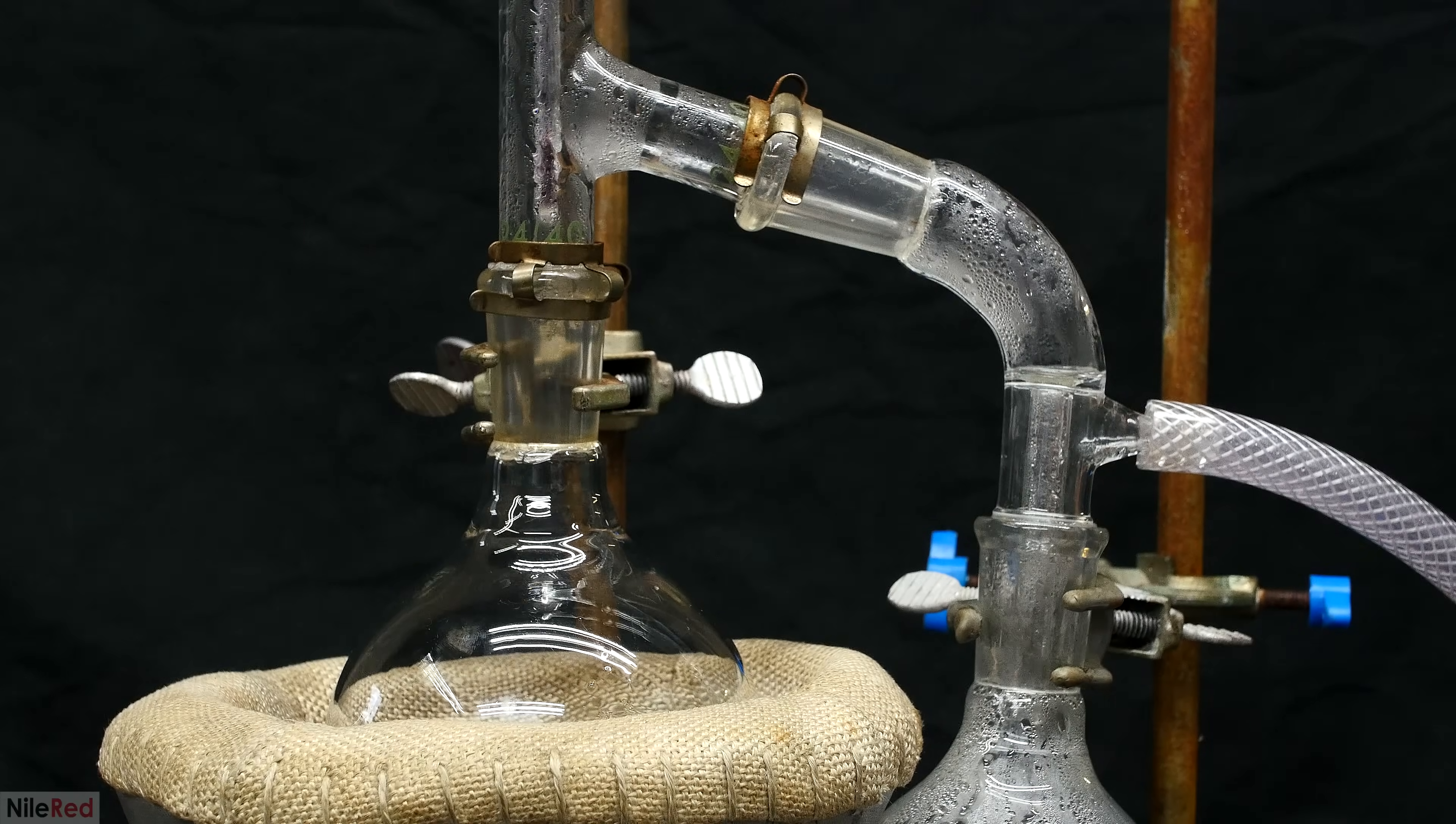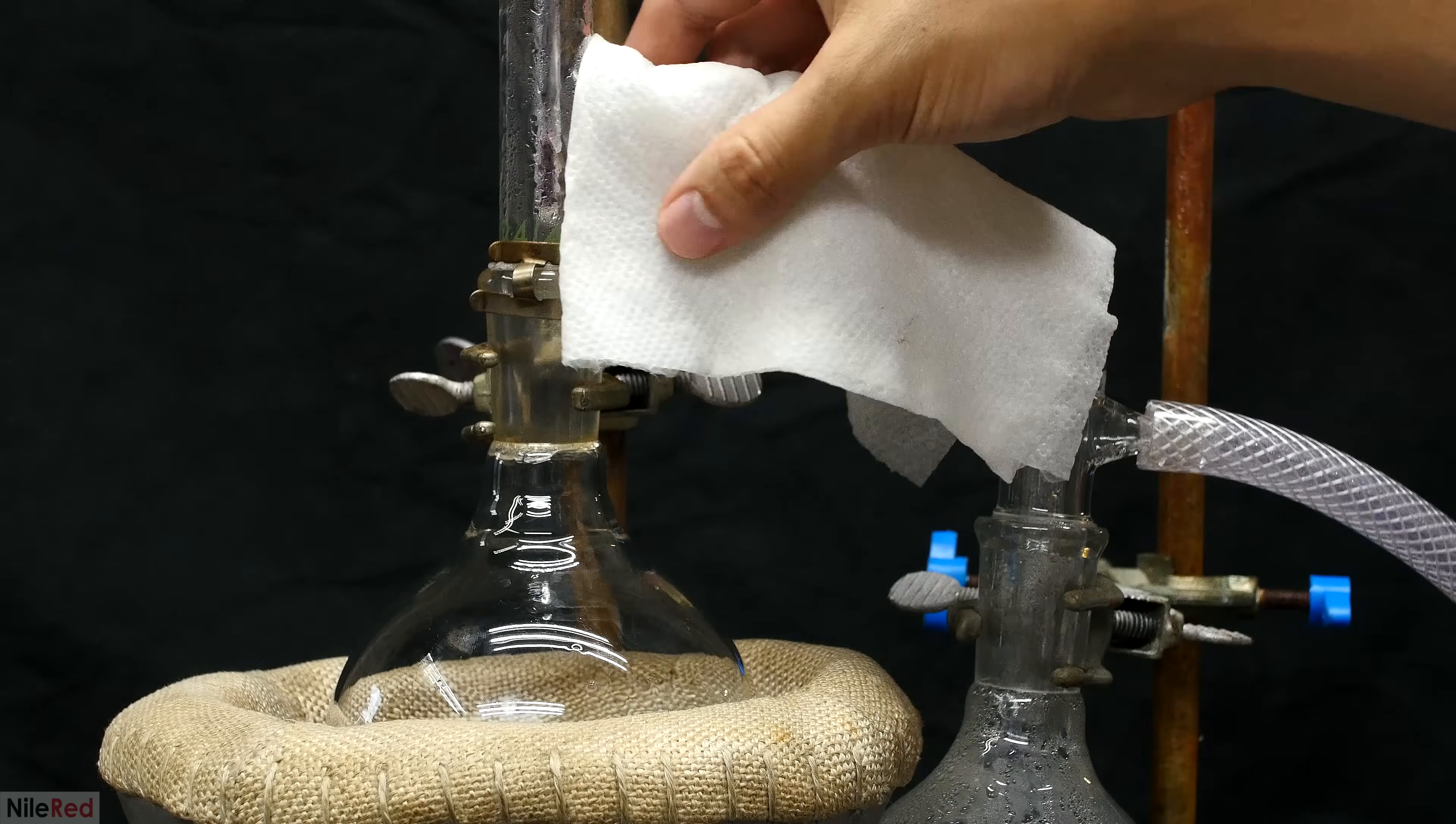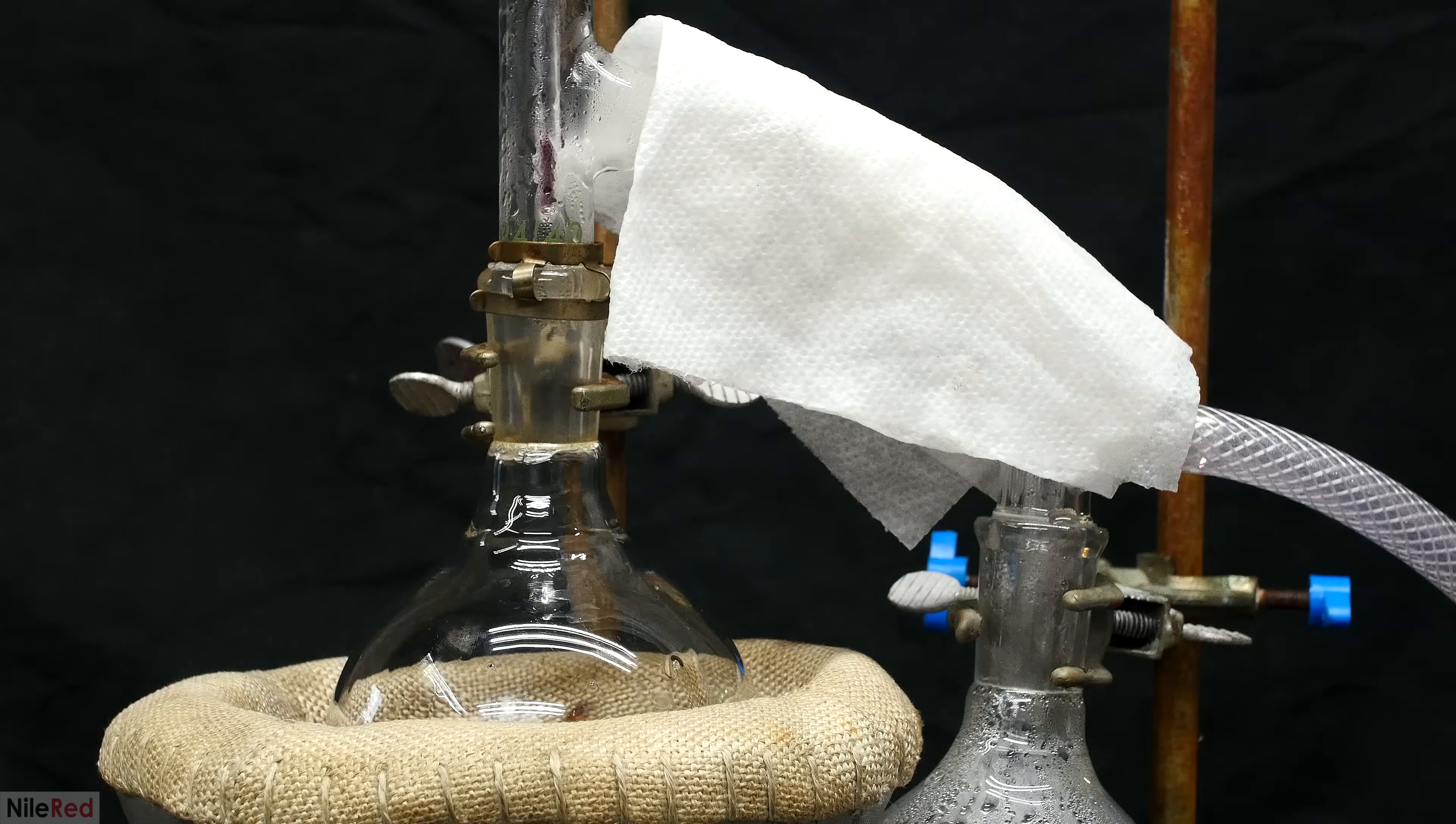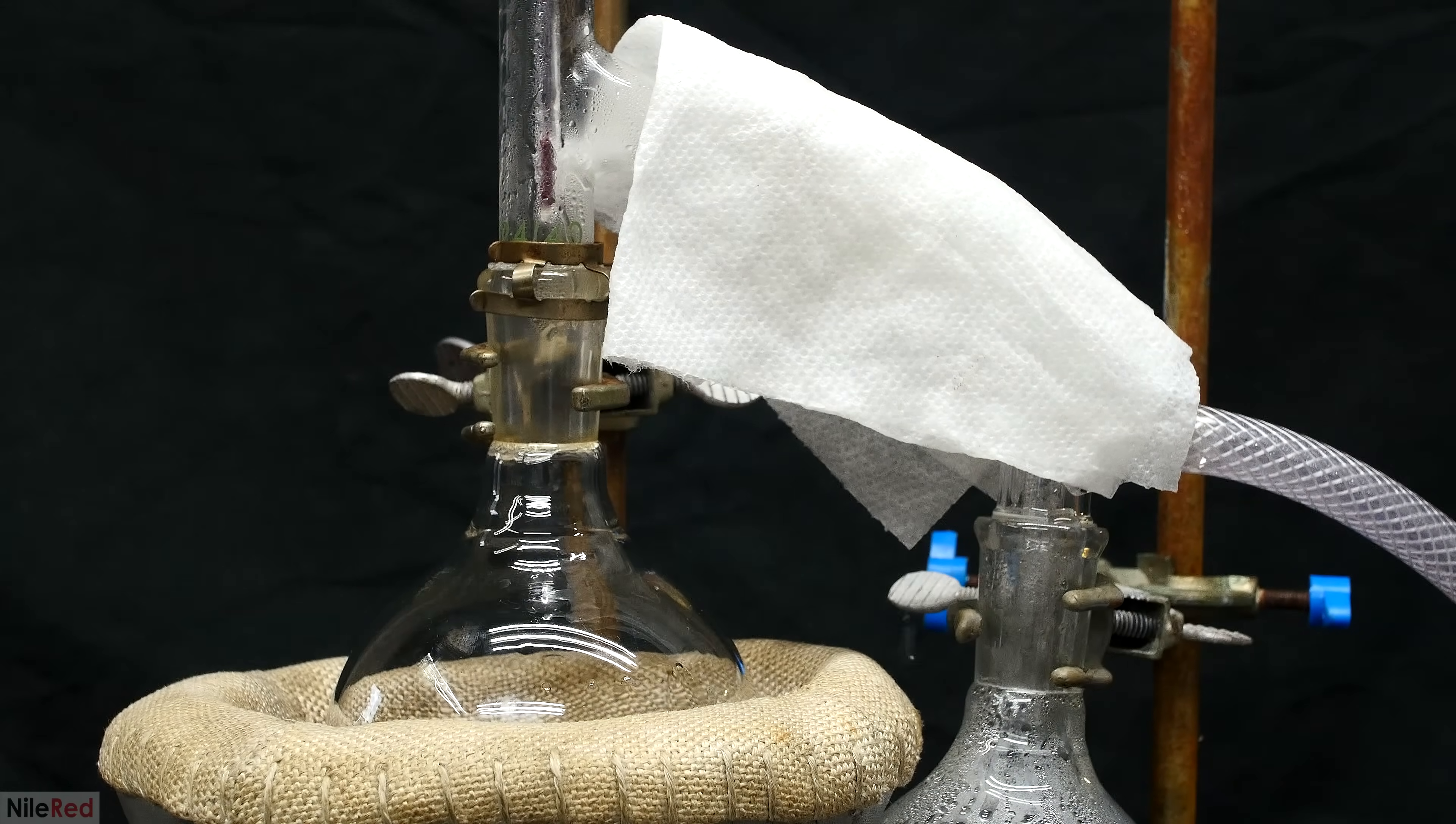To condense as much of the phenol as possible, I set up a ghetto paper towel condenser. I place a cold towel on the apparatus, and it actually works pretty well.